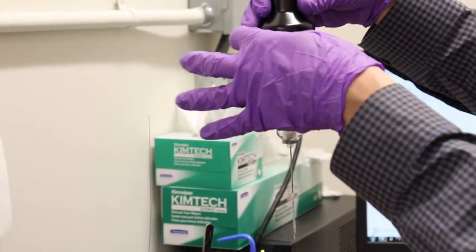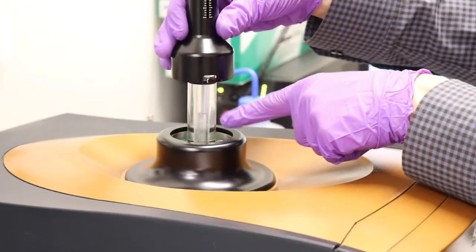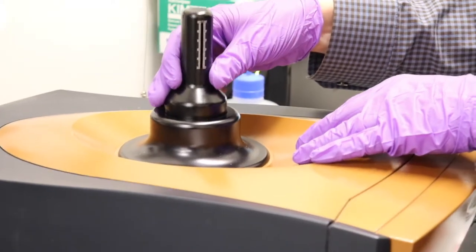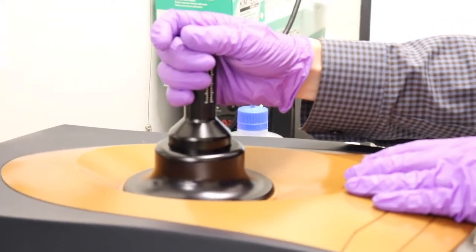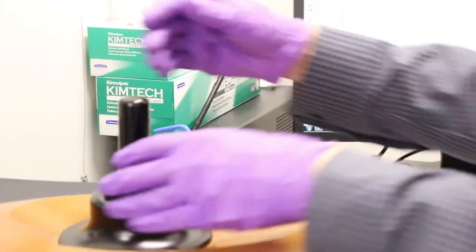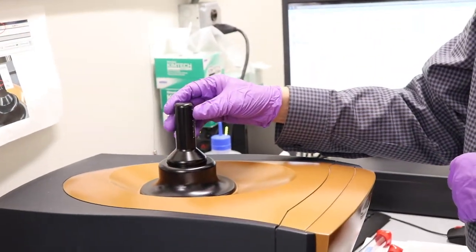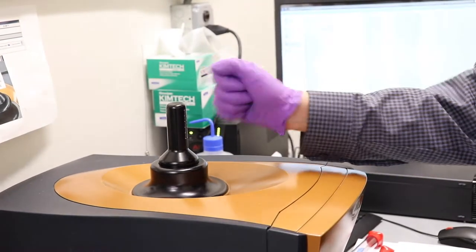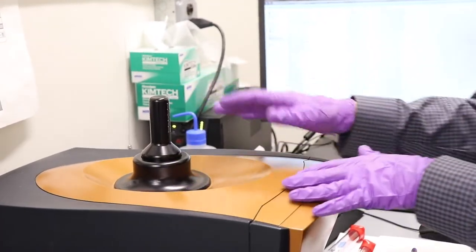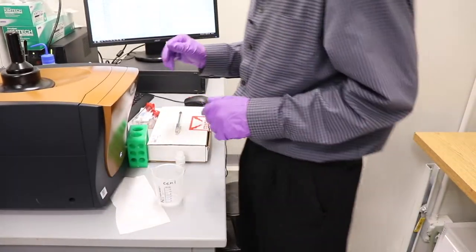And there's three notched clamps. So gently put it in, and once you get to the point of the Lexan getting in there, it'll be safe. So turn it so it's slightly off to the right, and you push it down, and snap it in position. It should be firmly in place. If it's a little loose, it's not hooked up right. You got to do it again. Since it's kind of tall and back there, if you can't quite reach it, there's a kick stool on the ground here you can use. Just be careful when you're doing that.